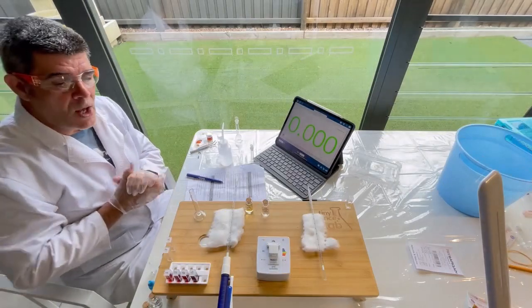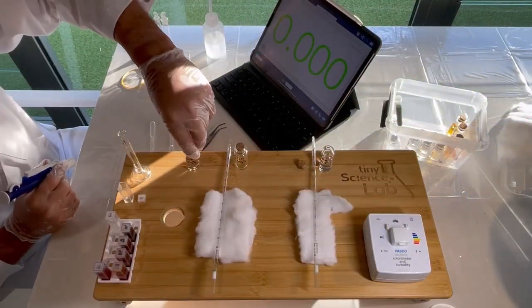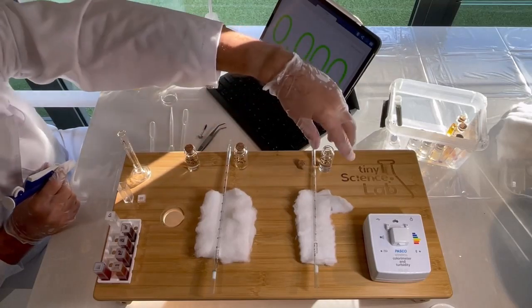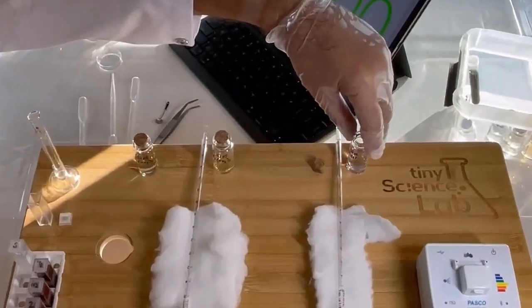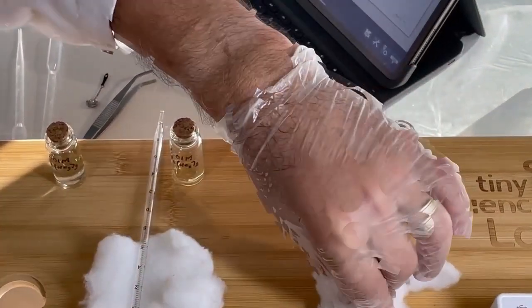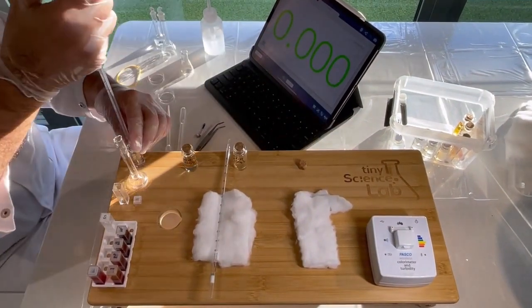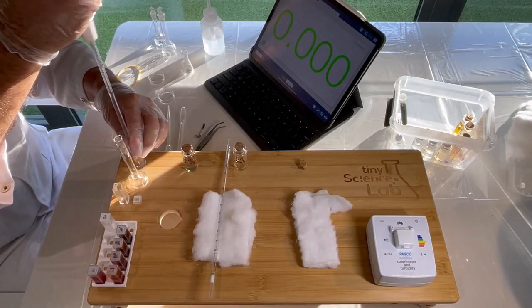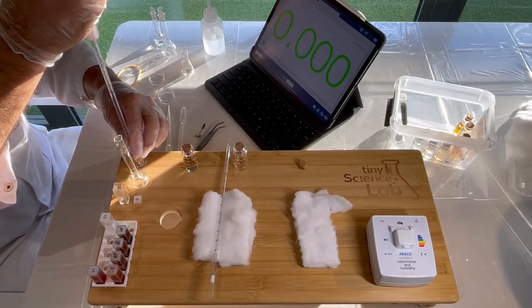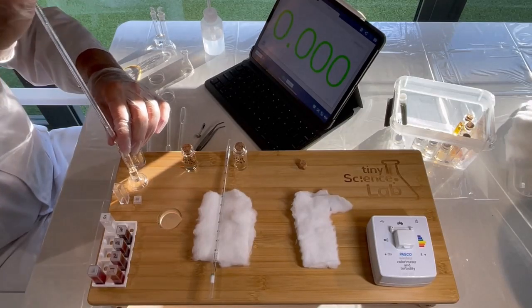Okay, so now it's time to make up our actual equilibrium mixture. So what we're going to do this time is we're going to add some of the same concentration of the potassium thiocyanate that we've used before, which is 0.01 molar. So I'm going to again grab 2 mils of that, but this time I'm going to drop the concentration of the iron nitrate. So I'm now going to be using a 0.001 molar solution.